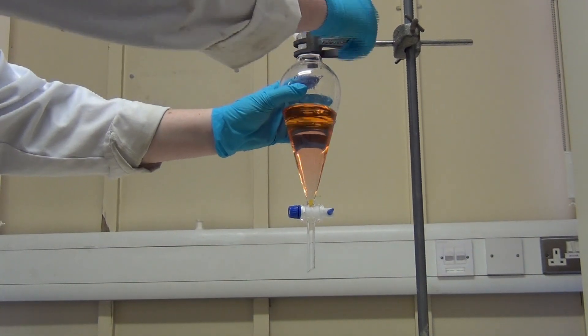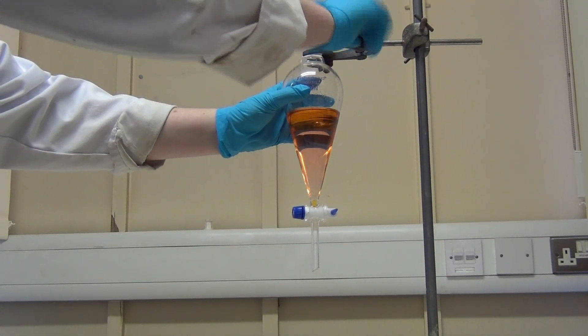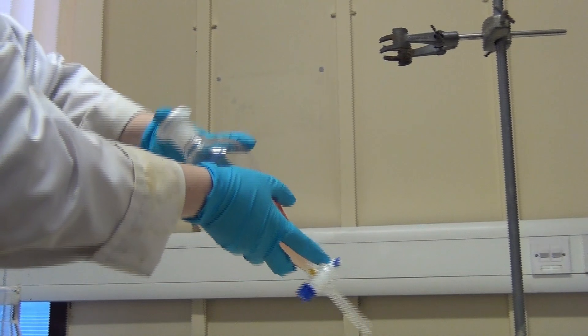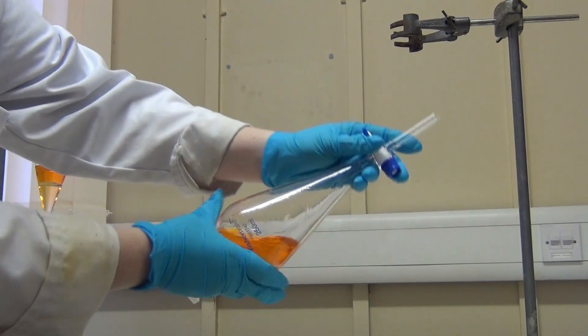In order to carry out an efficient extraction, we must ensure that the organic and aqueous layers are thoroughly mixed. We do this by inverting the funnel.